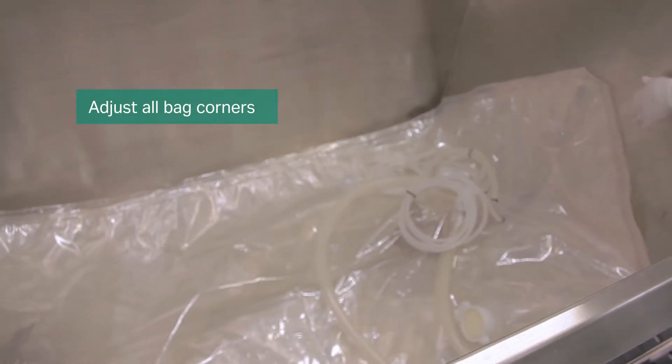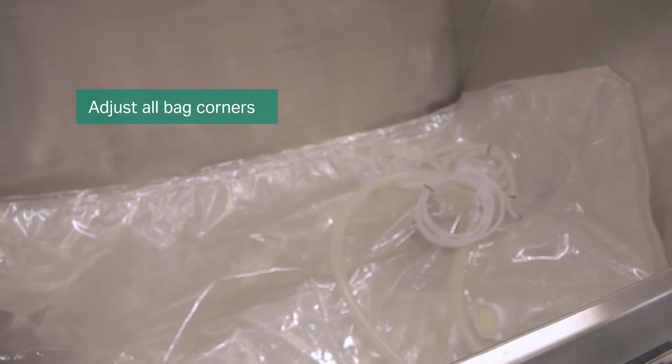Adjust all bag corners to the vessel corners and stretch out the bag to avoid wrinkles.